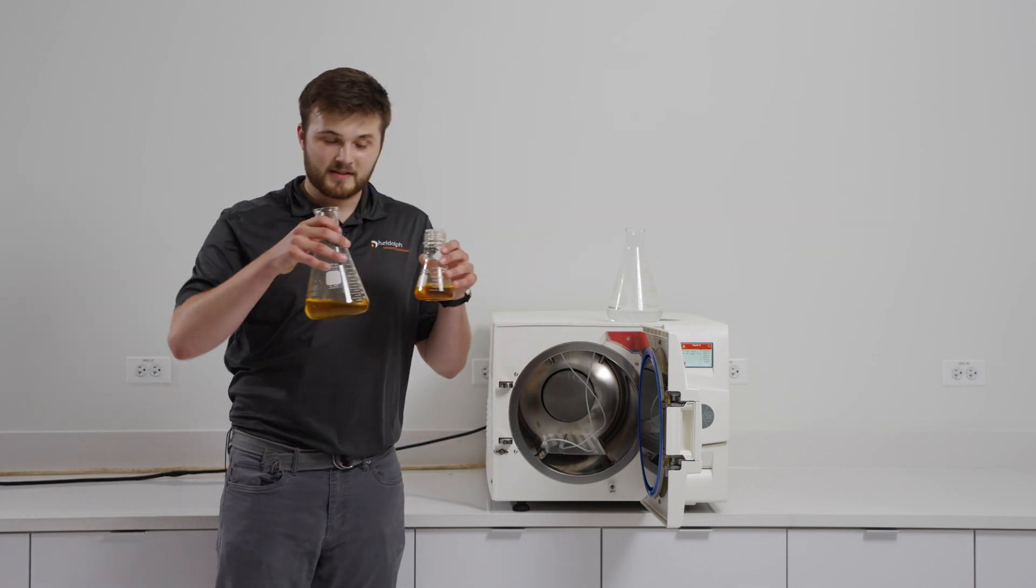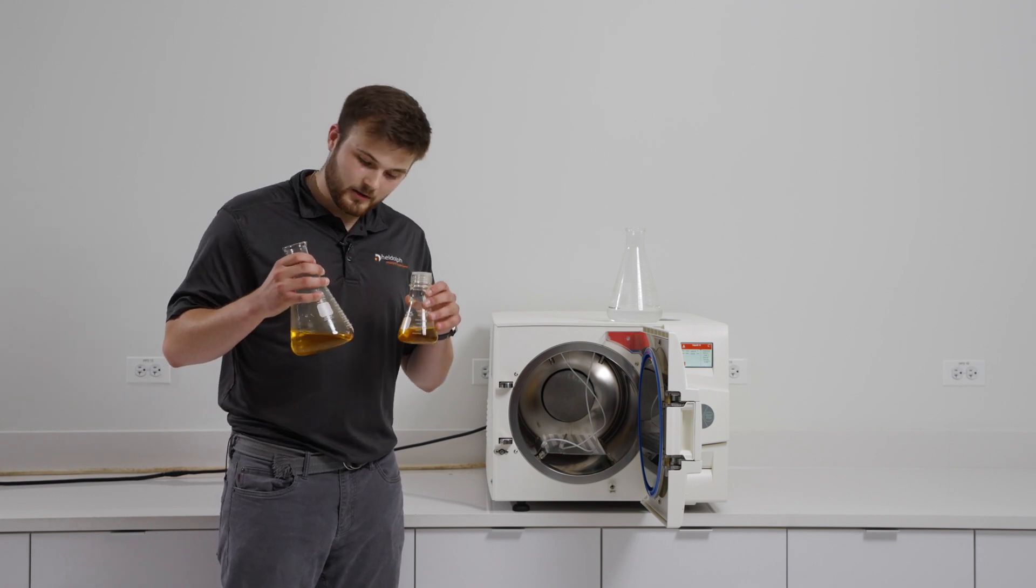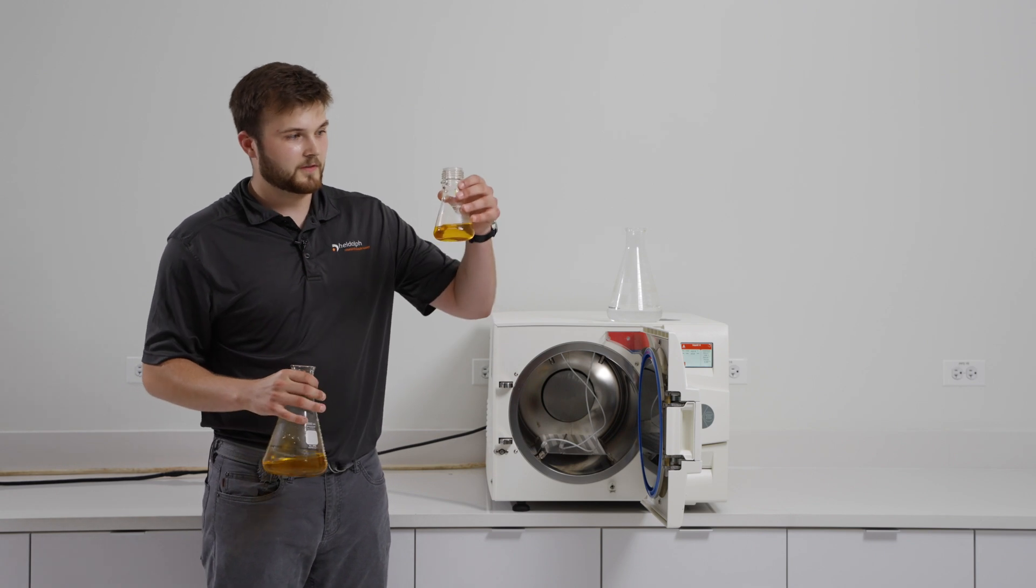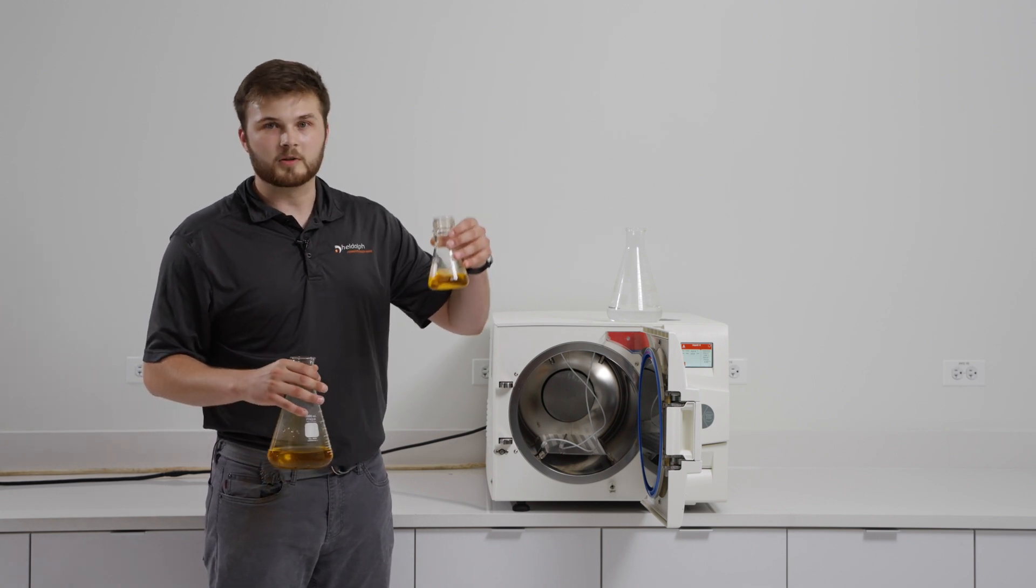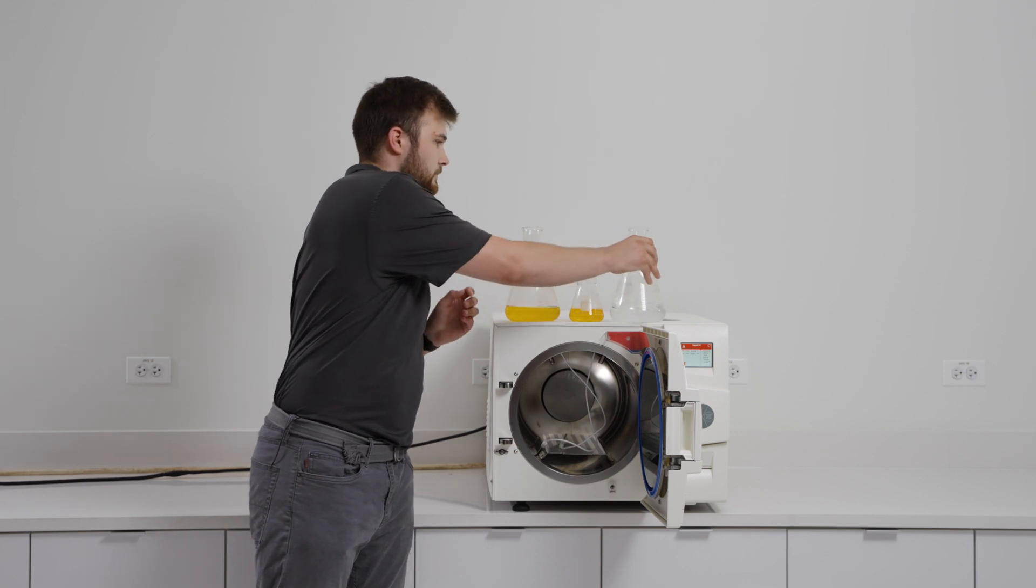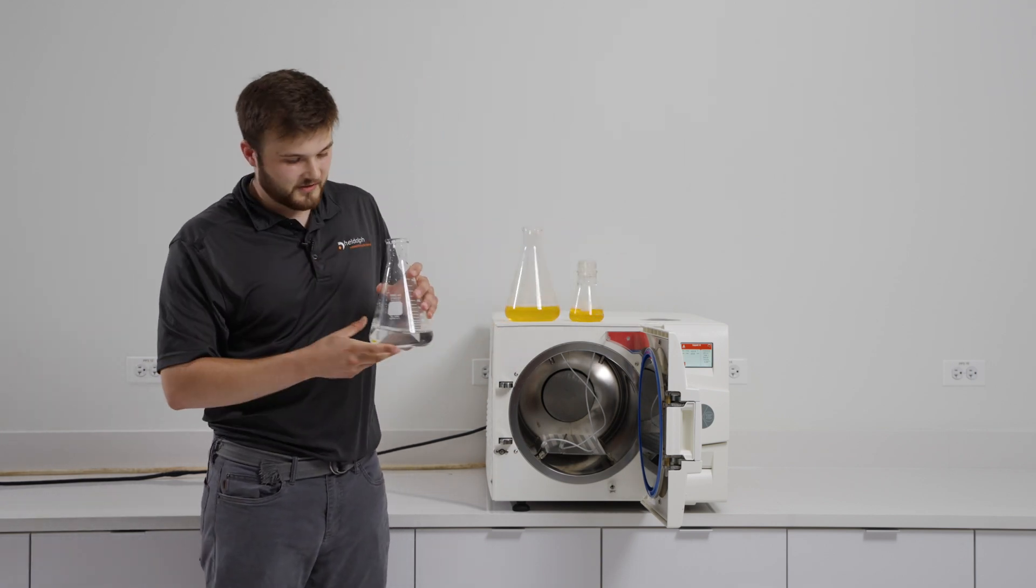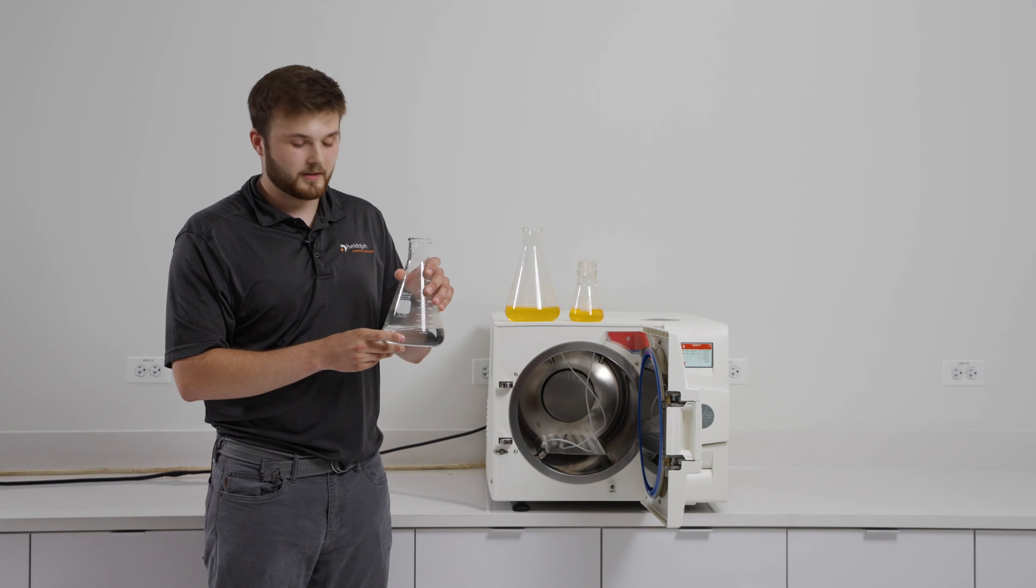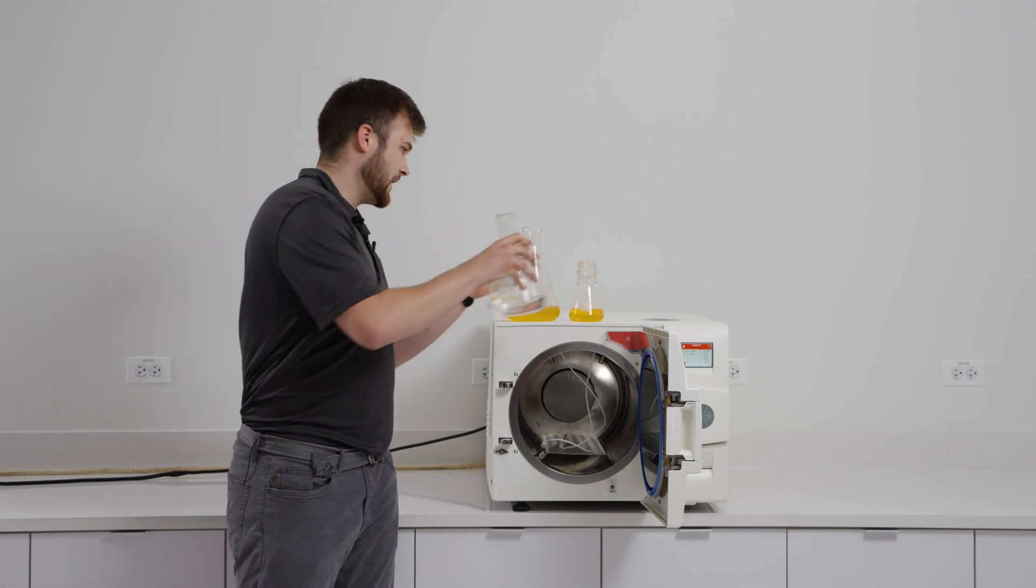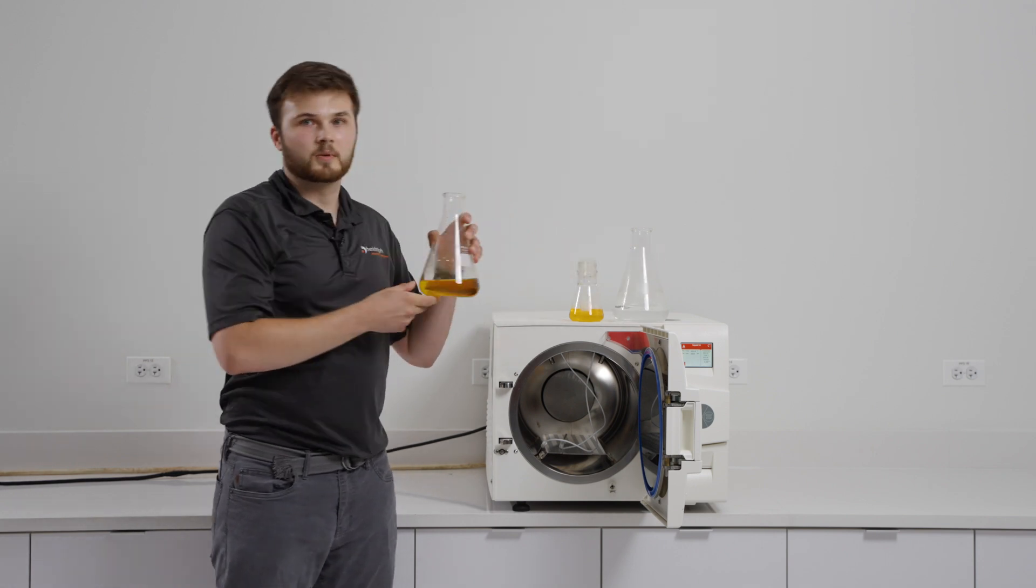I've got two different size flasks here with my media in them. I've got a liter flask with 350 milliliters of my media in it and a 250 milliliter flask with 100 milliliters of my media in it. Here's my control vessel, my control flask with water in it. It's got 350 milliliters of water in it to match that larger volume of my media.